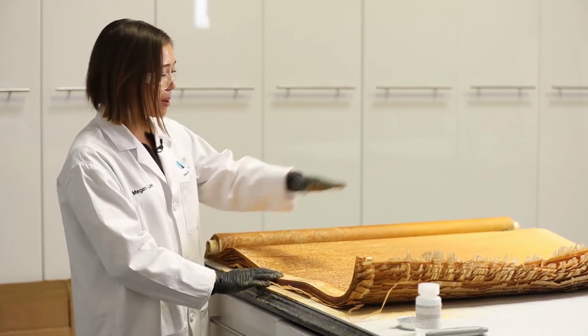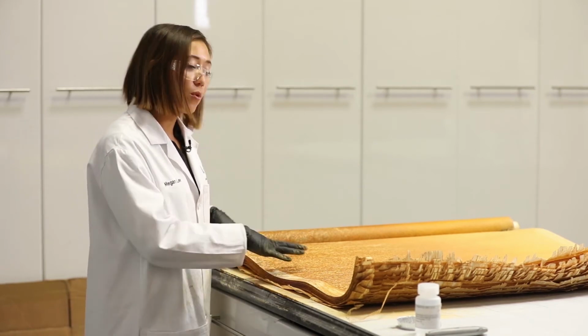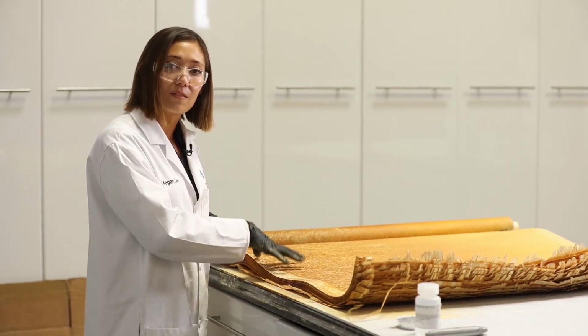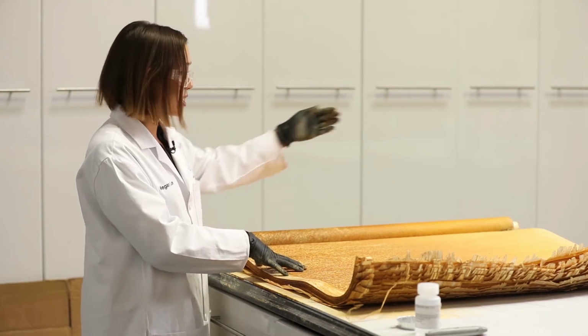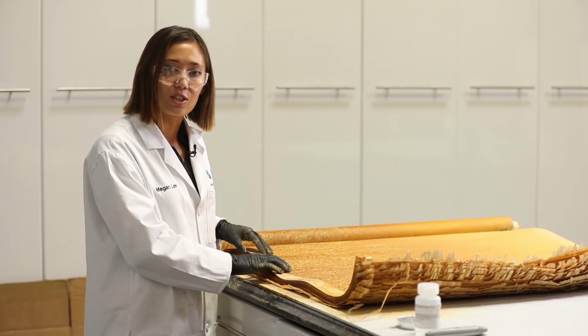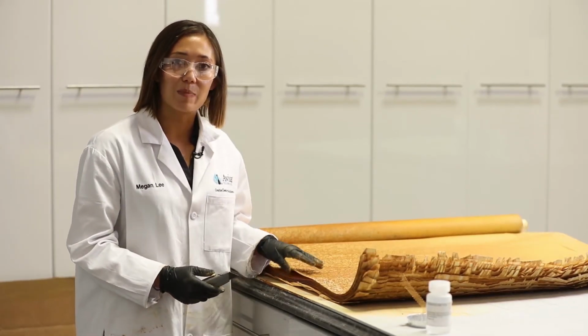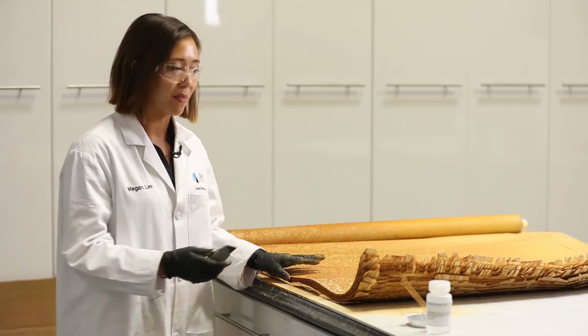As we inspect the membrane surfaces, we see that they are slightly unevenly fouled. We have more foulant material deposited towards the feed end of the element compared to the concentrate. This is also a contributor to delta pressure during full element wet testing. Our next step is to inspect the permeate side of the membrane.